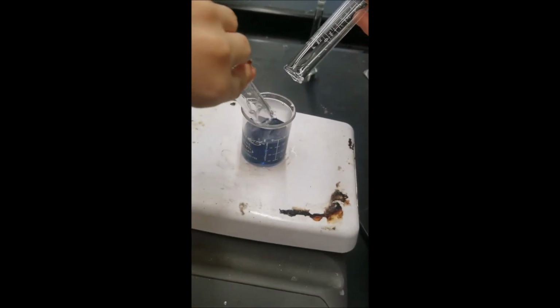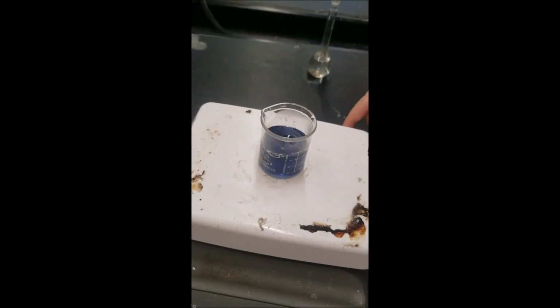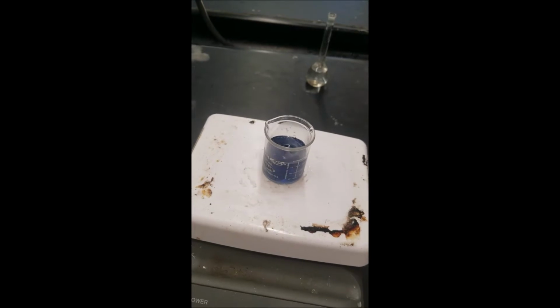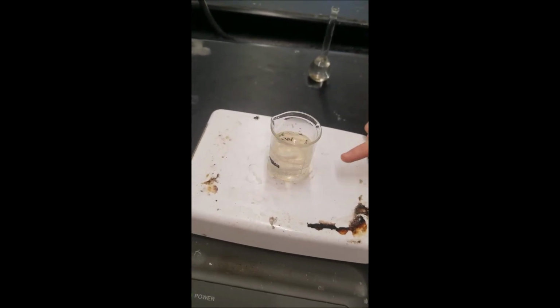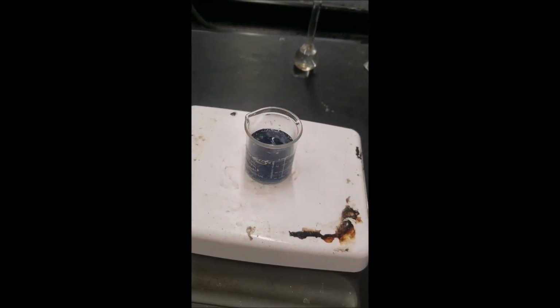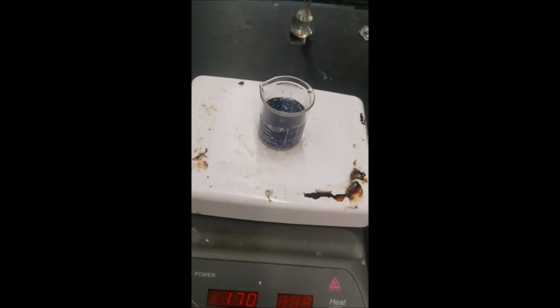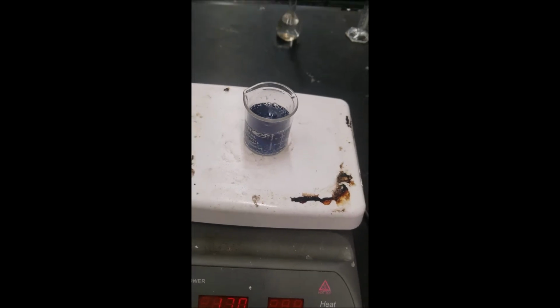Oh, well, so as you see, we're going through three stages of iodine and starch solution. When the iodine goes all the way to the reduced form, it goes to an iodine starch solution. Then it becomes fully oxidized back to iodate, and it goes to where it's clear, and it goes into iodine, where it's turning yellow, but when it builds up, it reforms as starch.